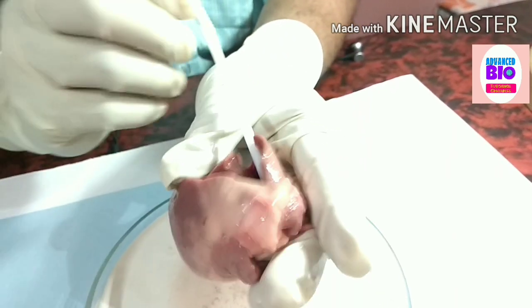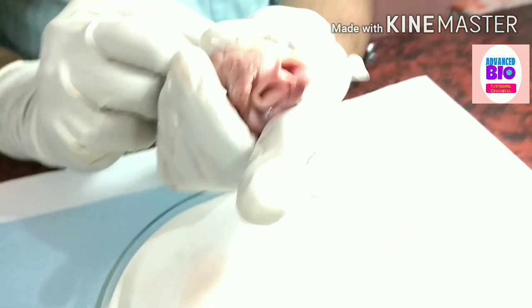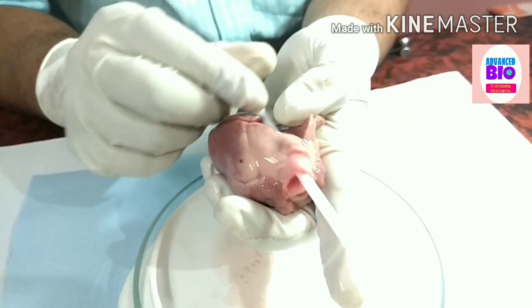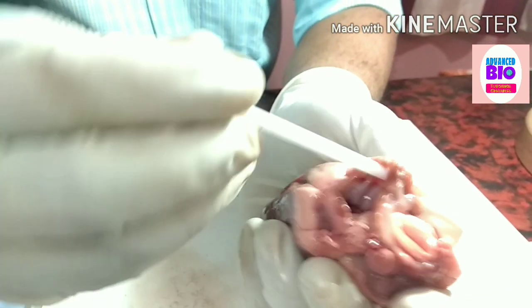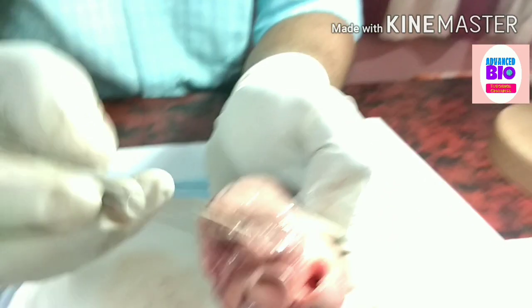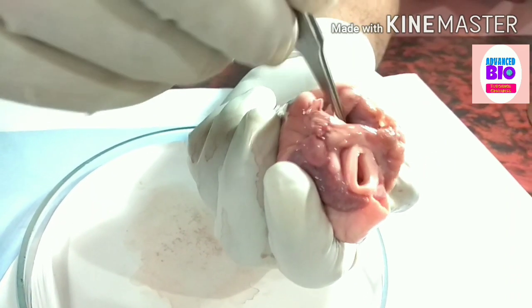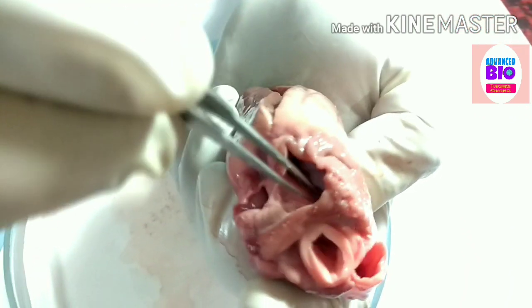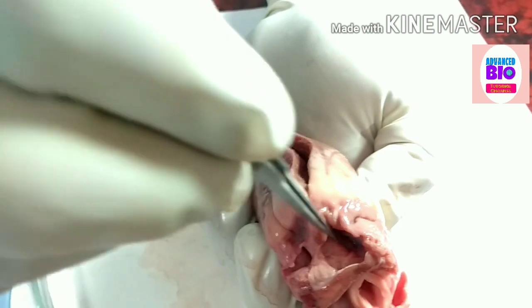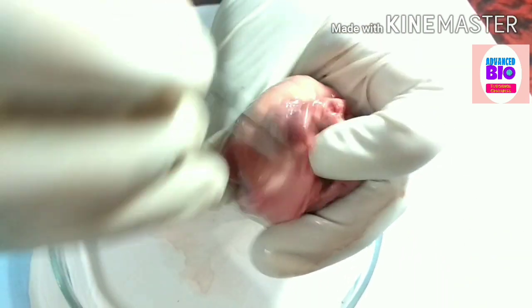From the right ventricle, there is the pulmonary artery connected to it. Now see the atrium — this is the left atrium and this is the atrial chamber. This is the left ventricle, this is the left atrium, this is the right ventricle, and this is the right atrium.